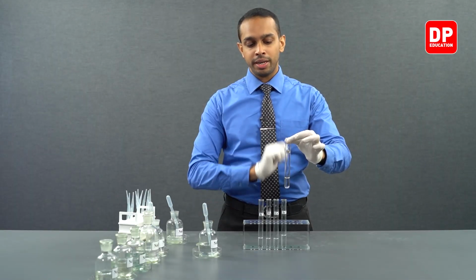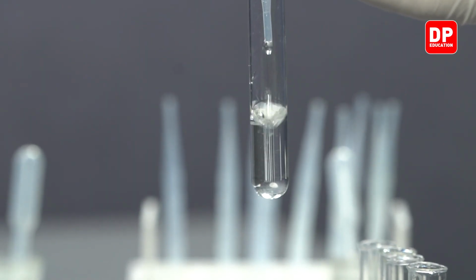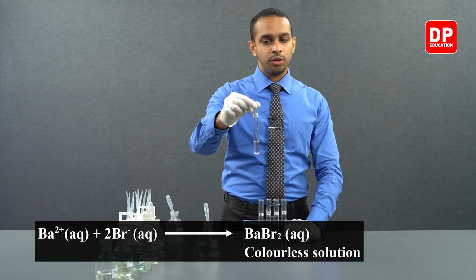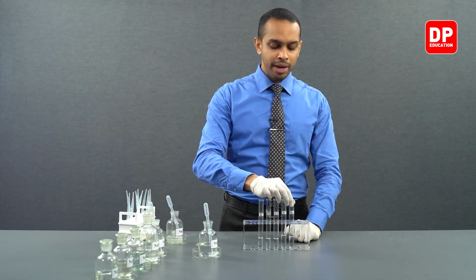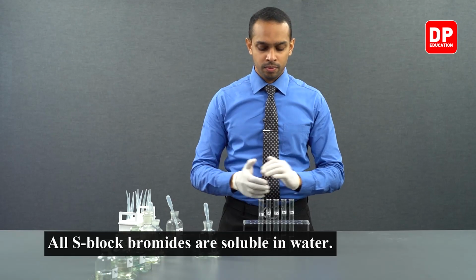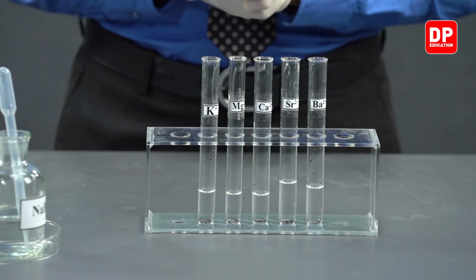Finally, we have our barium ion solution. Let's add a little bit of bromide ions to barium, and let's mix it up. You can see when barium is reacted with bromide, you form barium bromide. Even barium bromide is not forming a precipitate because barium bromide is soluble in water. As you can see, when bromide ions were reacted with these cations, we did not form any precipitates.